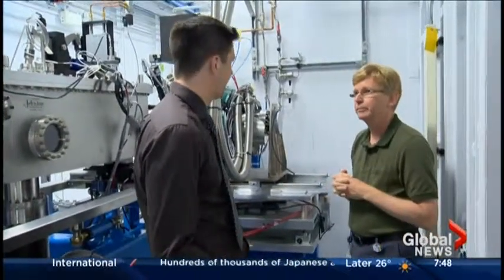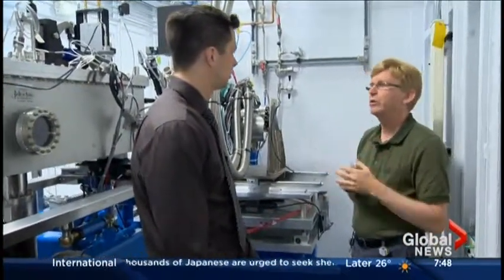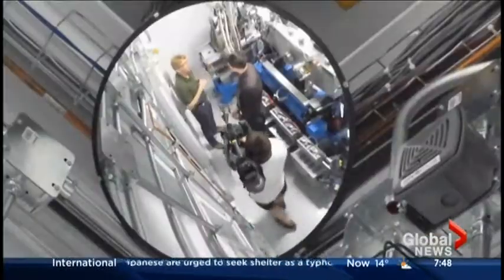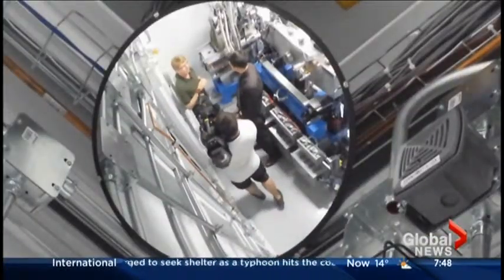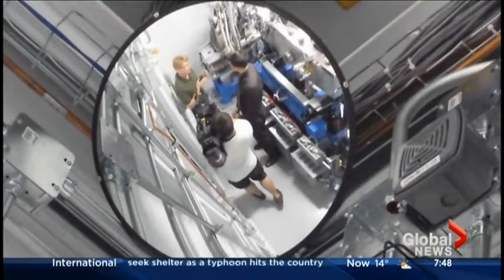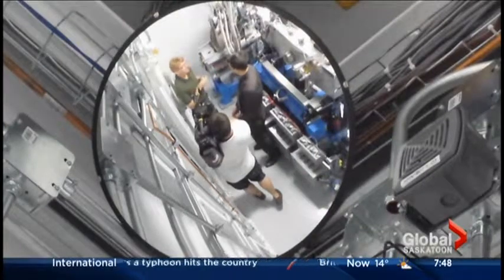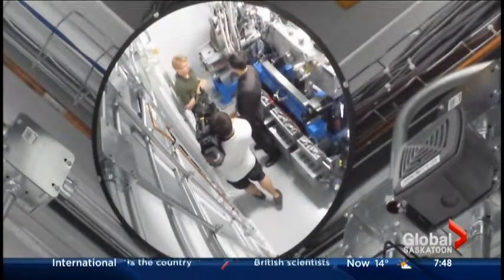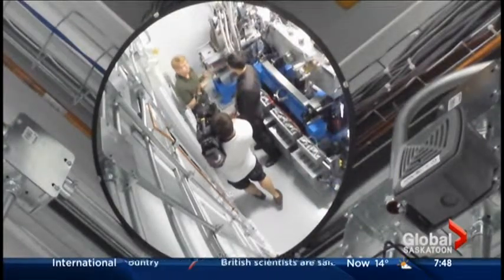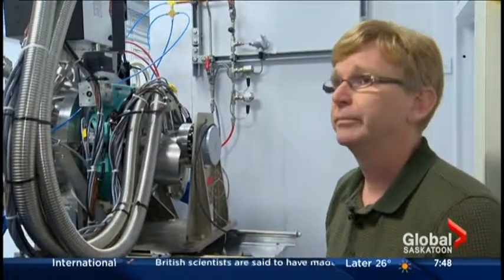Each beamline is here to do a particular type of experiment. The BioXAS beamline is basically being designed for people doing biological sciences, looking for things like metals inside living systems.